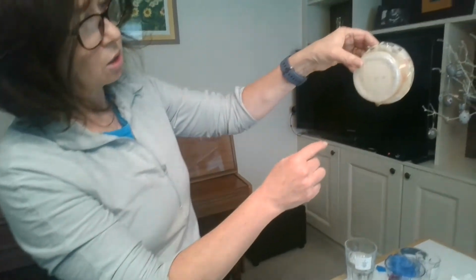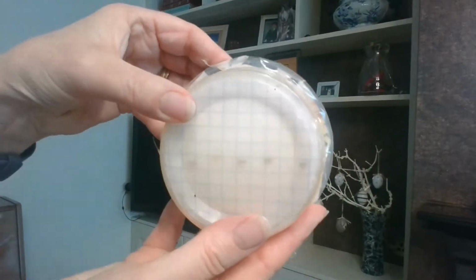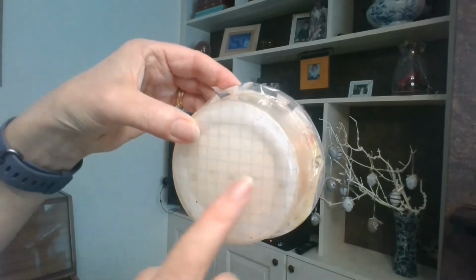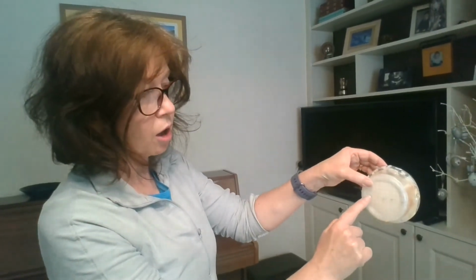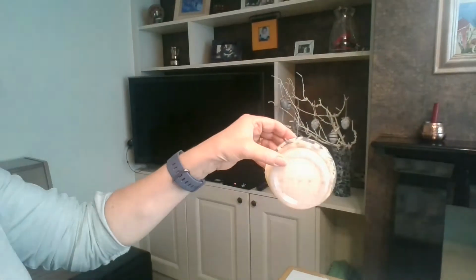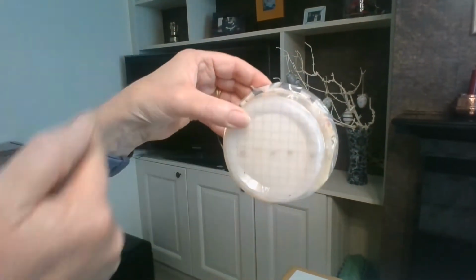Now it's not too bad. You can just about see across there are my seeds. They're in a horizontal row. So that means horizontal, that is obviously vertical. The filter paper and the cotton wool is keeping them in place. So now I want to see what effect my different concentrations of IAA have on these seeds. They're going to start growing. Shoots are going to grow up and roots are going to grow down. Not in all of the Petri dishes, but most of them. And we're going to see which ones grow better, which ones grow bigger.